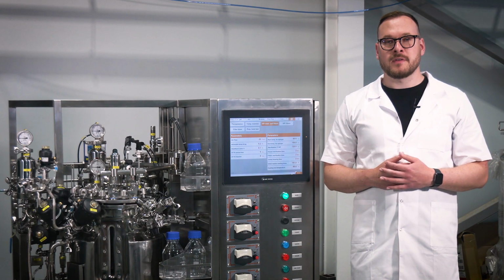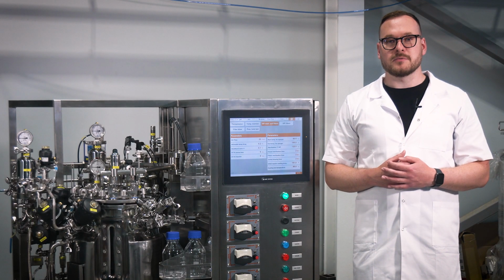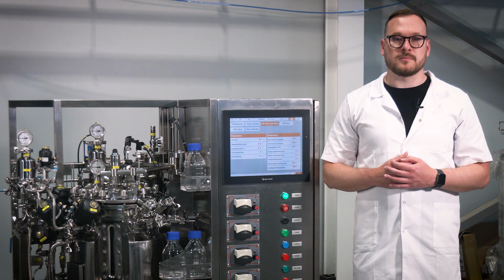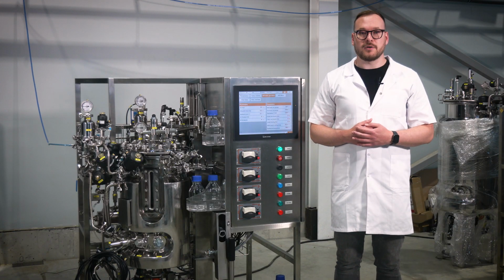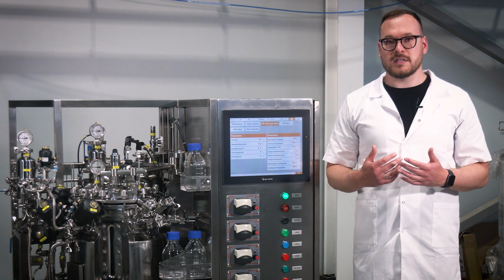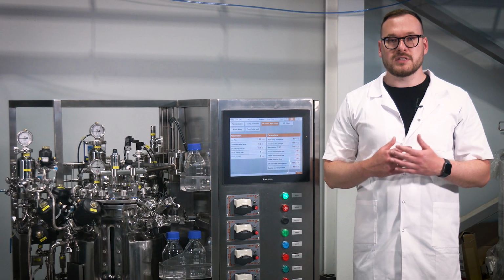Preparation steps. Before operating the system, all operators must complete a course on working with the fermentation system or become familiar with the user manual. Follow these steps to prepare the bioreactor for operation. Check operating conditions and quality of the process media to meet the specified requirements. Ensure valves, connections, and screws are in normal condition.